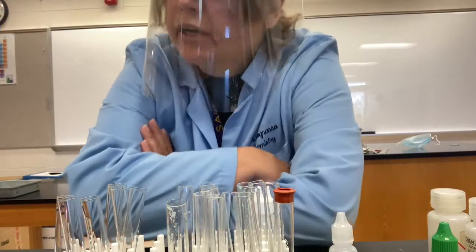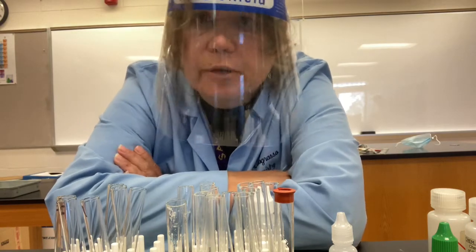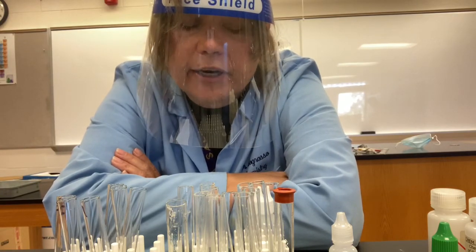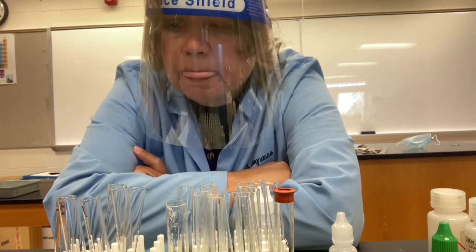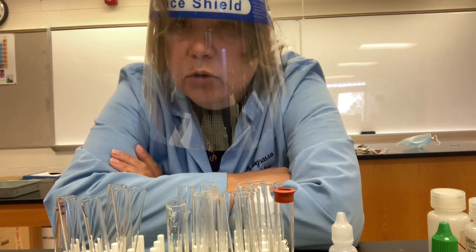So now we're going to do an analysis of bleach. Bleach consists of sodium hypochlorite, so sodium ions and hypochlorite ions, which are written OCl in the lab, but you can write them also ClO negative, dissolved in water to make bleach. The sodium ion, we've already seen a test for that. That's a flame test. So this test is going to demonstrate a test for the hypochlorite ion.